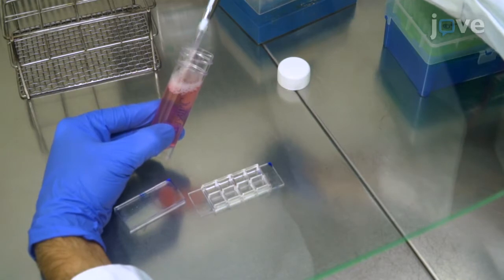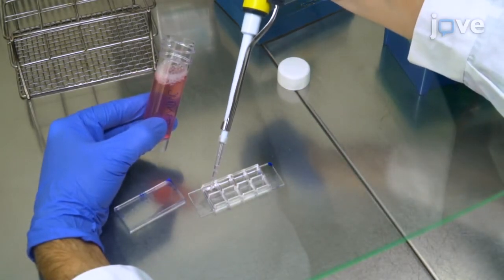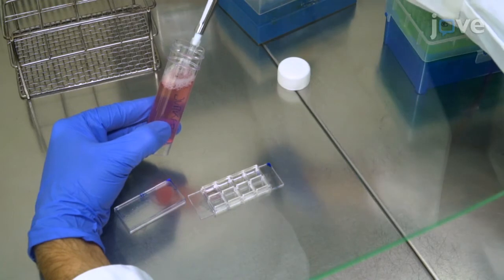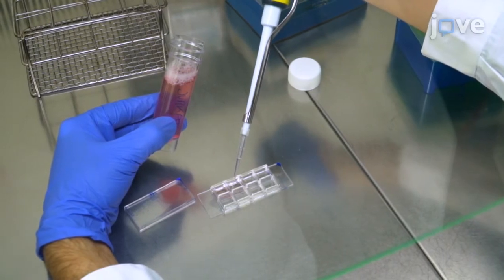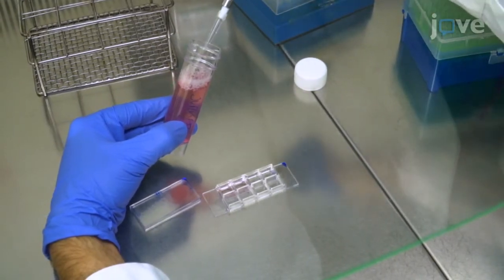The approach presented here involves cell-to-cell conjugation, time-lapse acquisition, wide-field fluorescent microscopy, and subsequent image processing. This improves the signal-to-noise ratio of the images, enhances their temporal resolution, and allows the simultaneous acquisition of several fluorochromes in emerging synaptic conjugates, and decreases fluorescence bleaching. In addition, the protocol is compatible with endpoint fixation protocols that will allow immunofluorescence staining and analysis. This protocol is also compatible with laser scanning, fluorescent microscopy, and other state-of-the-art microscope techniques.